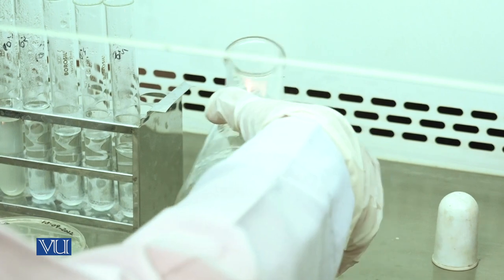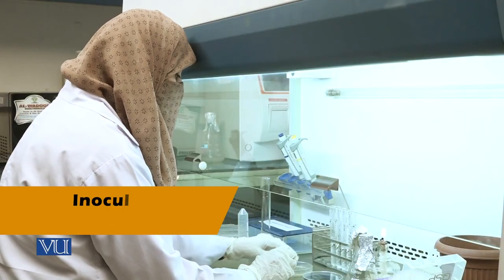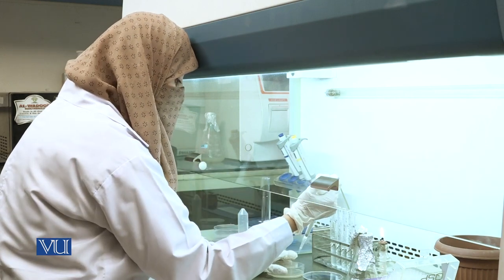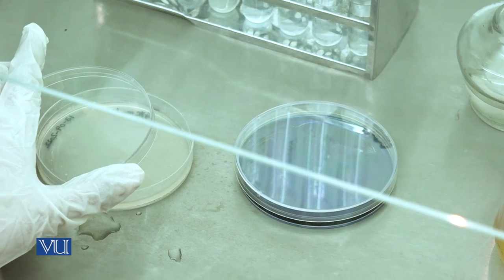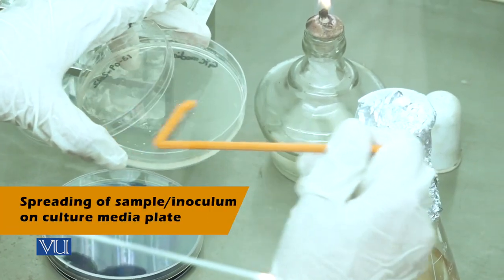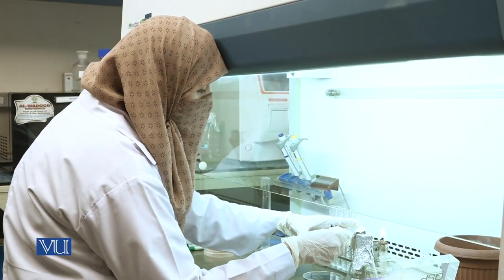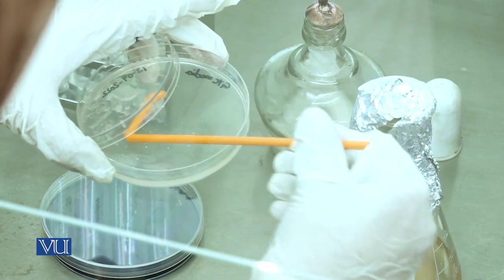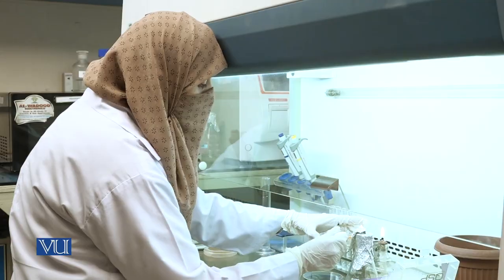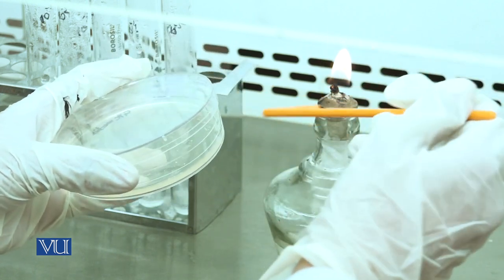Add antibiotic solution to media. Now inoculate the plate with the grape sample from 10 to the power of 5 dilution. For spreading, place the plate near the flame and spread the inoculum evenly throughout the surface of the agar, distributing the sample evenly until the inoculum is fully absorbed.